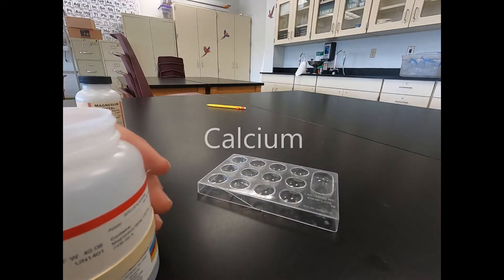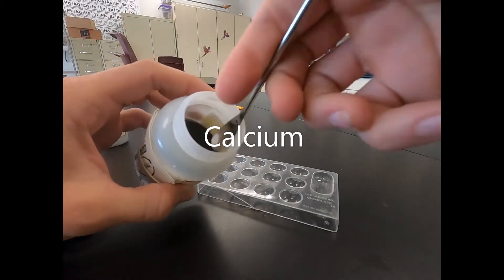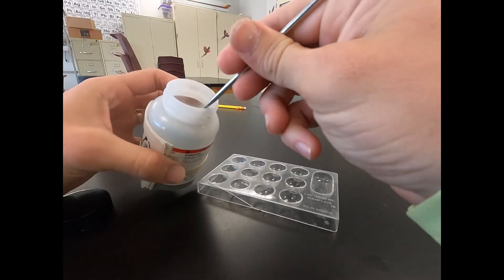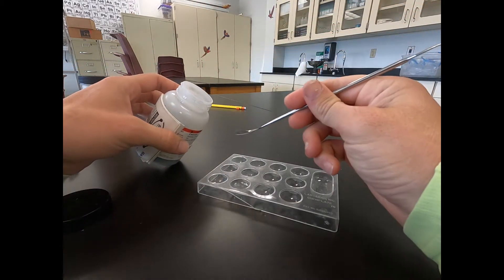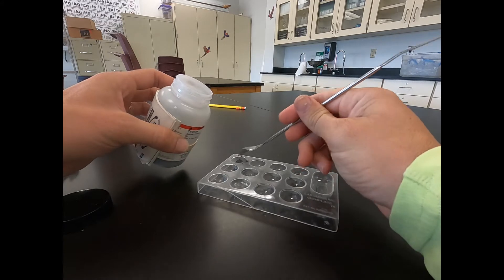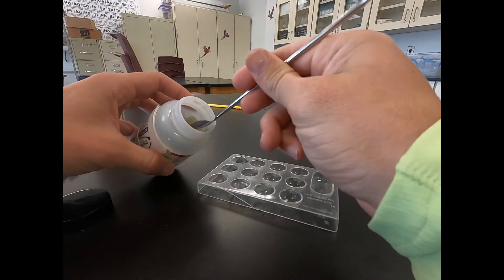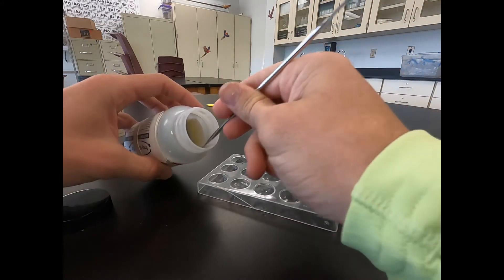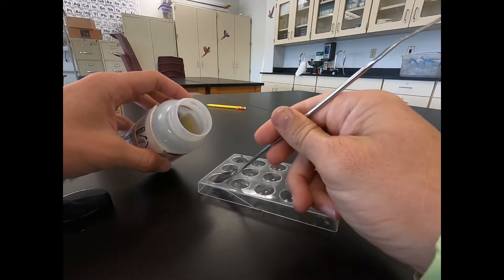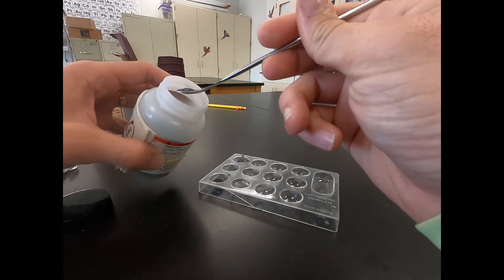So first we have calcium. We're just going to take a small scoop of our calcium and we'll place that one in the top of our well plate, and then we'll place a little more down at the bottom of our well plate. We don't need a whole lot — we're not looking for an exact amount today. So that's our calcium.